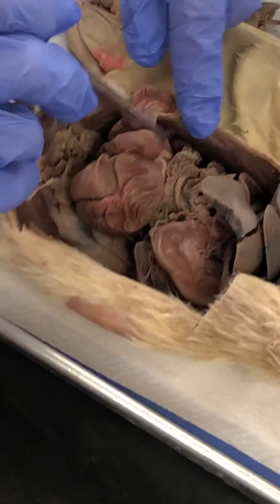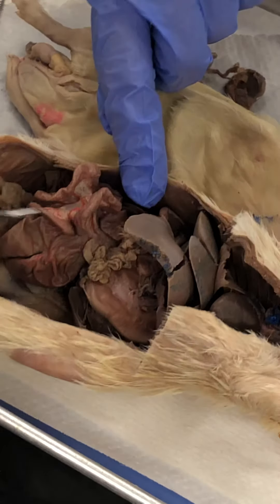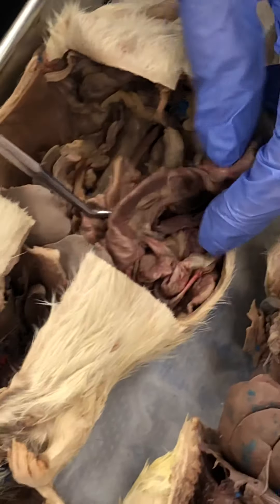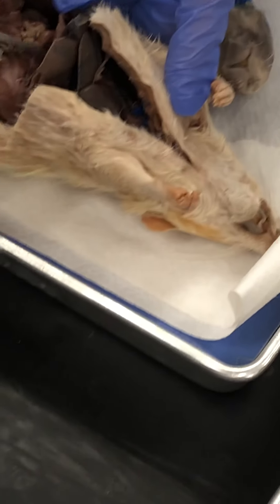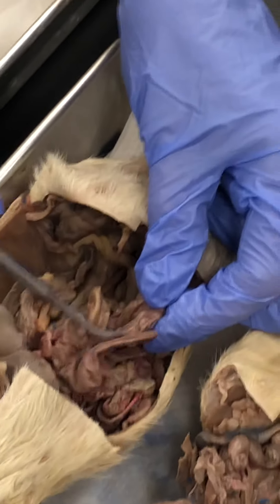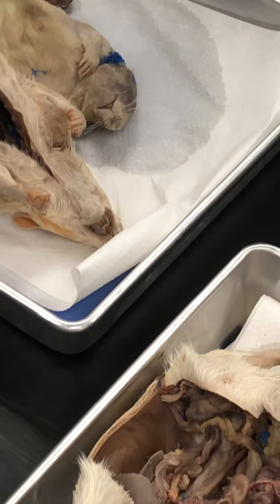The coily part you see in here — all of that is the jejunum. The end of the small intestine is the ileum. The red pin section is the duodenum, the white pin section is the jejunum, and the blue pin section is the ileum. The red, white, and blue pin structure together would be the small intestine.